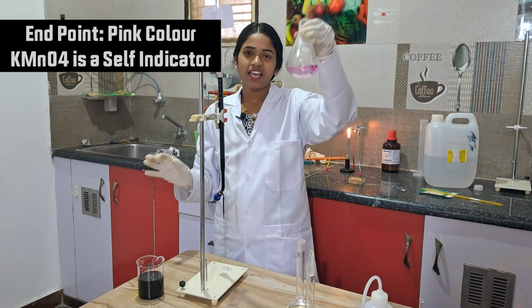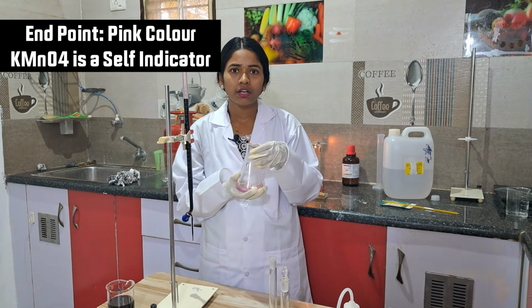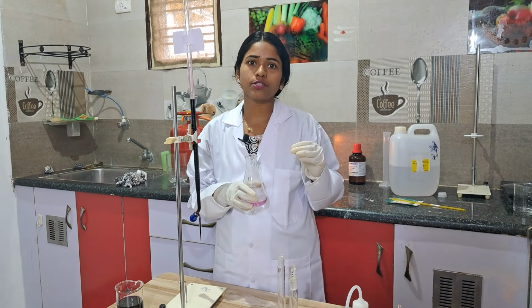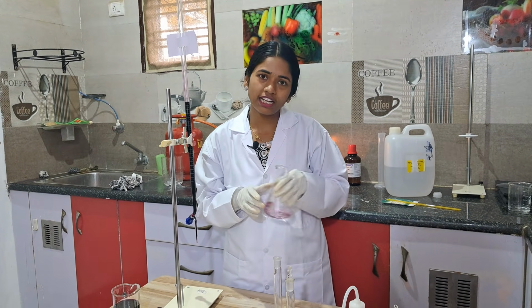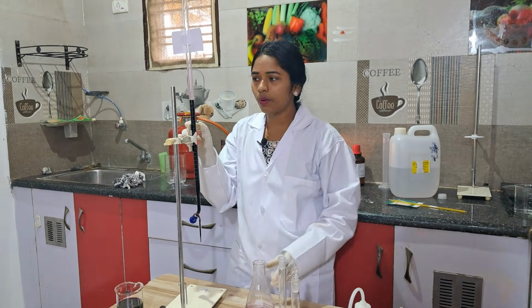Correct? If you prepare the solutions in such a manner, anyhow you need not prepare them, your lab in-charge will give them to you. But even so, I will tell you how to prepare them, so that if at any time you are not getting support from your college team, you can do it yourself. That's it. Now see the reading. Come here.